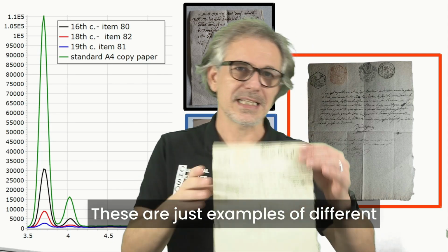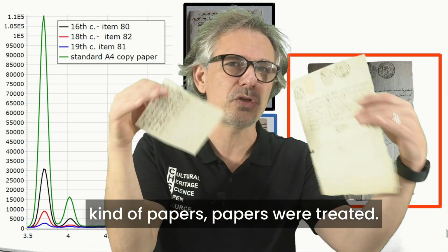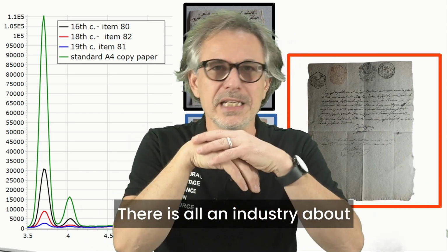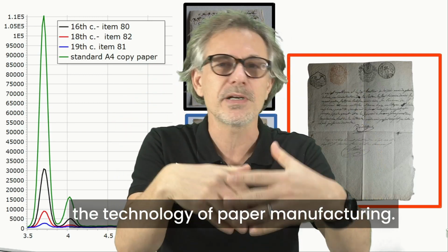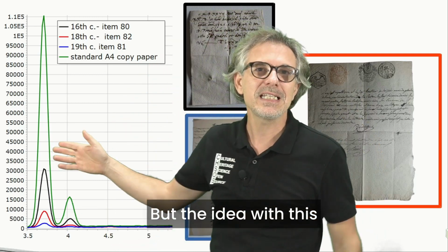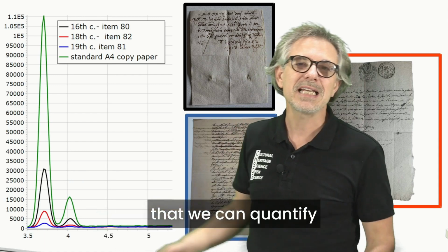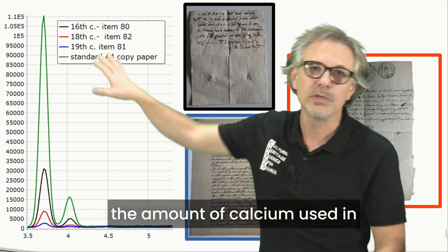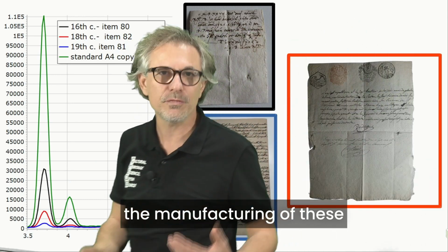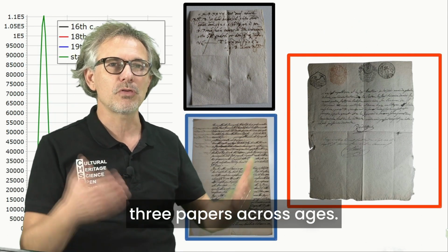These are just examples of different kinds of papers. There is a whole industry about the technology of paper manufacturing, but the idea with this simple collection of spectra is that we can quantify the amount of calcium used in the manufacturing of these three papers across ages.